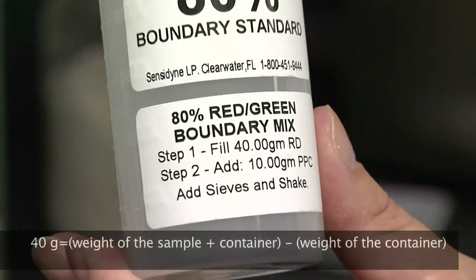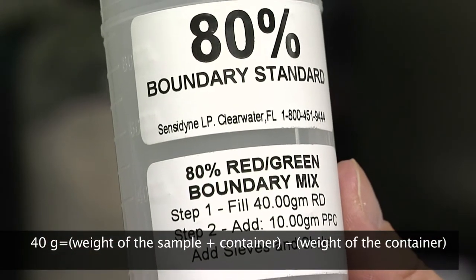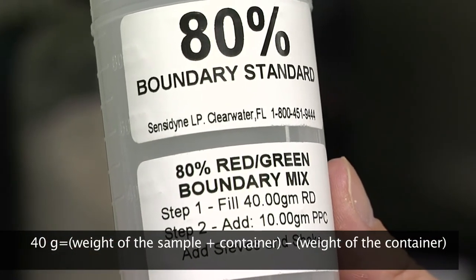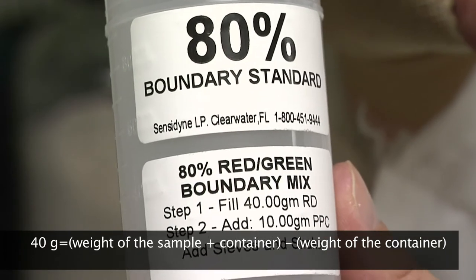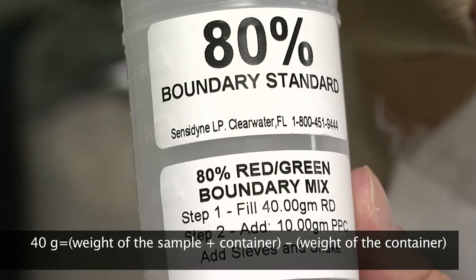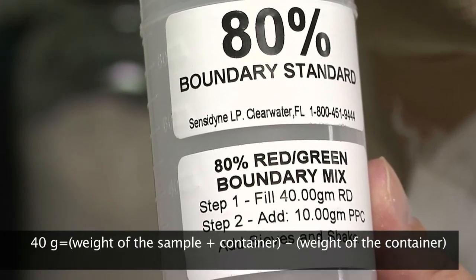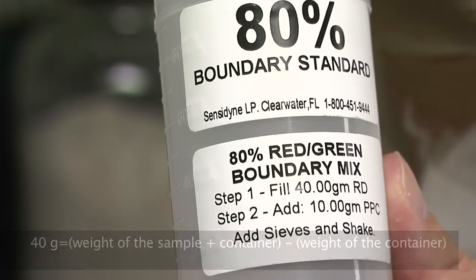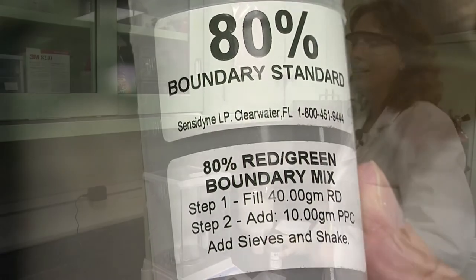On the container, there are directions. Step 1: fill 40 grams of rock dust. Step 2: add 10 grams PPC. Add sieves and shake.